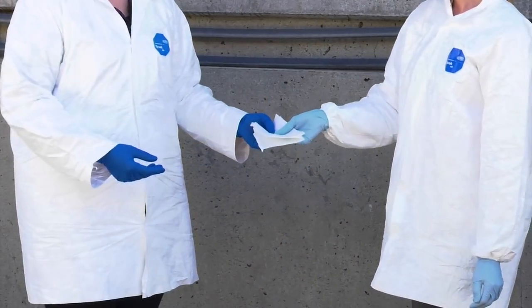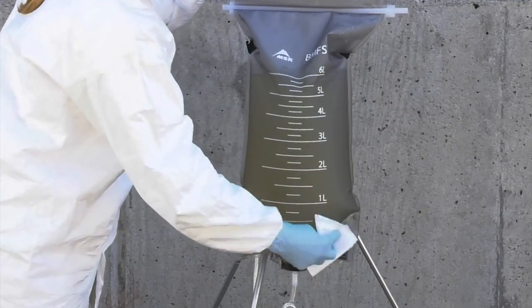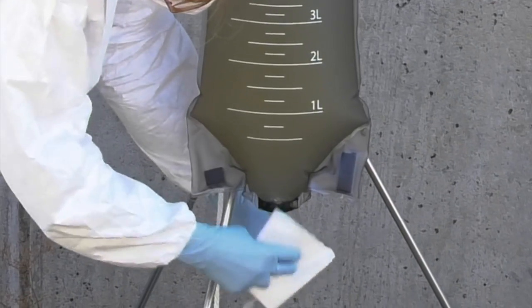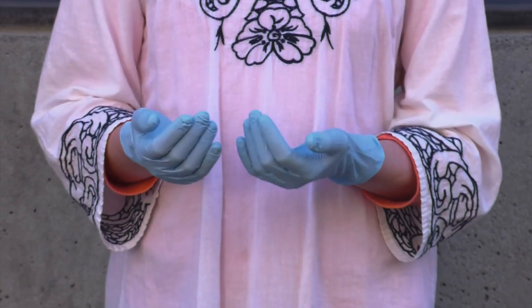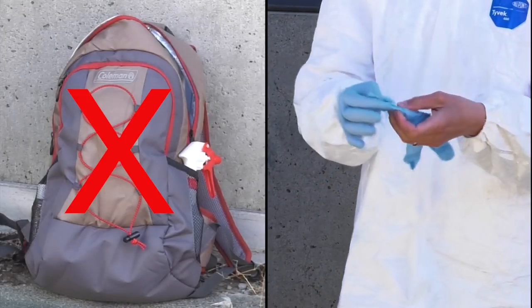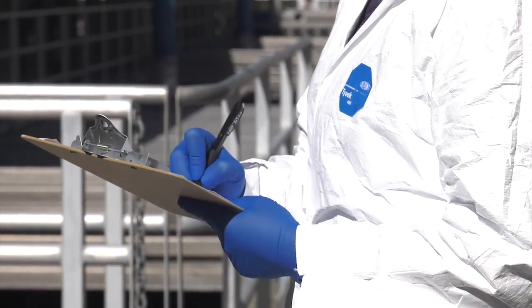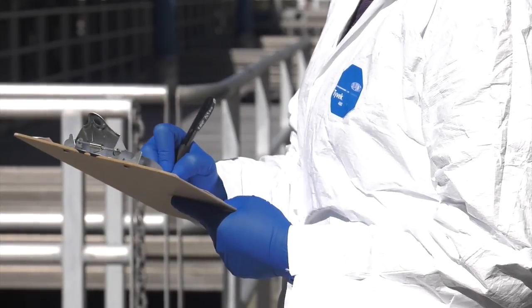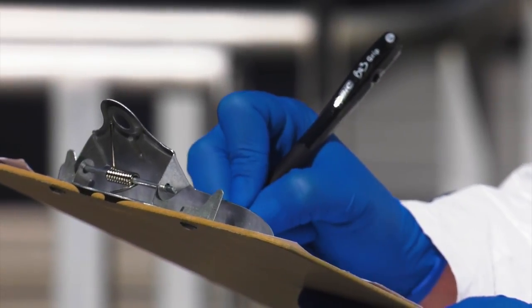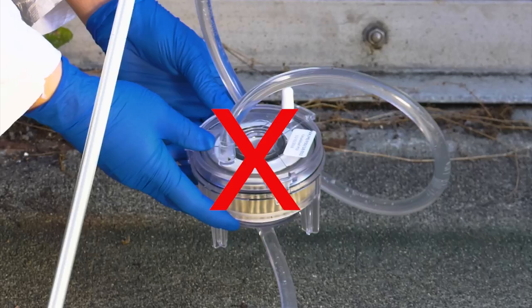Within a field sampling team, it is a good idea to designate two specific field technician roles. The first field technician will work directly with the sample — we will refer to this person as the direct contact technician, and in this video they will wear light blue gloves. This person will have dirty hands and should not enter the backpack or use clean items without changing gloves. The second field technician will hand items from the backpack to the direct contact technician, collect waste, and fill out the chain of custody form — we will refer to them as the clean hands technician, and in this video they will wear dark blue gloves.